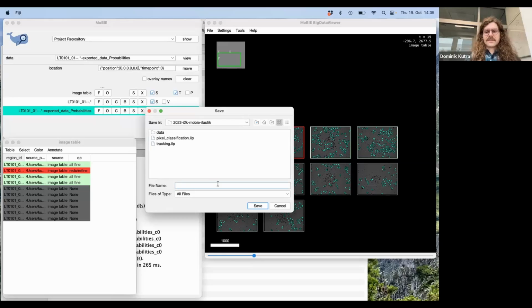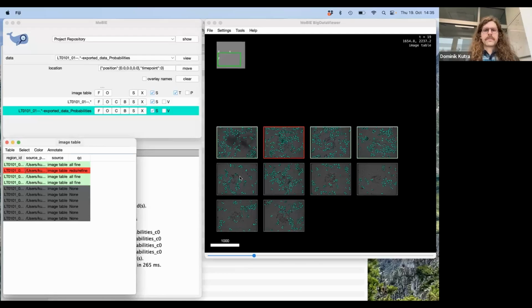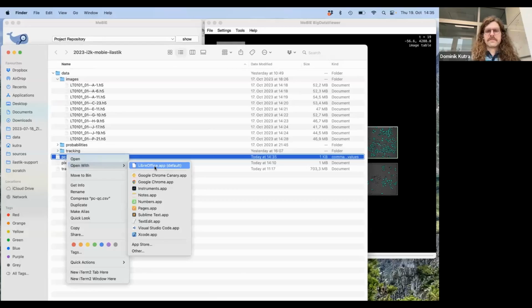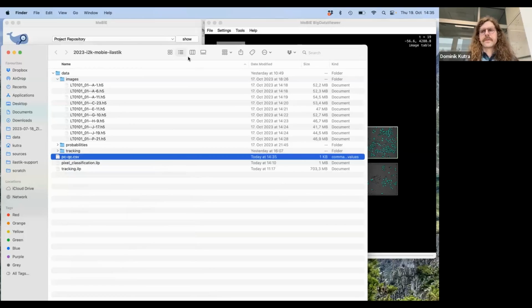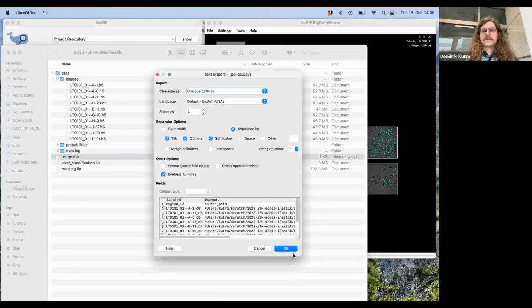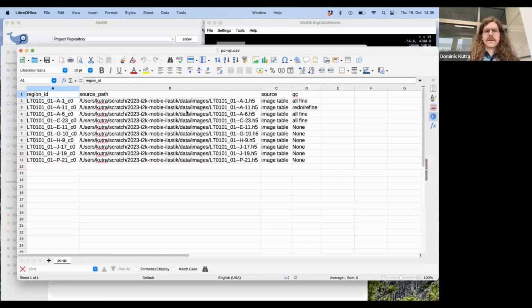So here I could say this is pixel classification QC.csv. And then this file here appears. I can open it with LibreOffice, for example. And there you will see the same as you've seen before. It has the paths to the images. It also gives them some ID, and you will have this quality control, whether everything's fine, you want to redo, and all of this recorded nicely linked to the image.